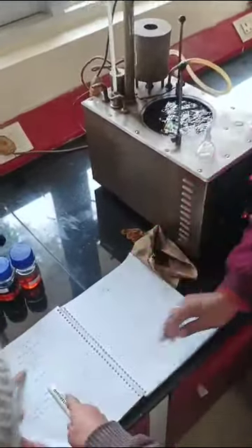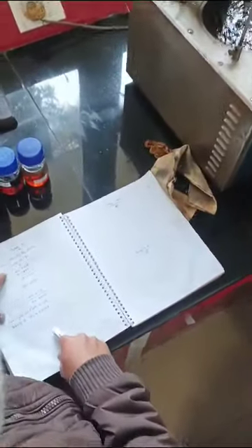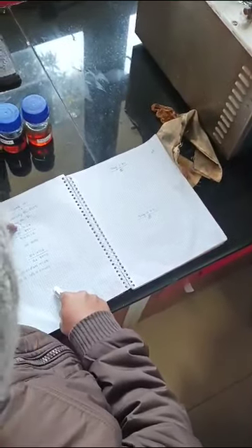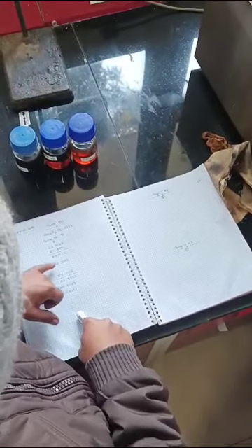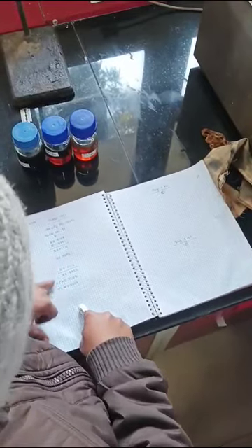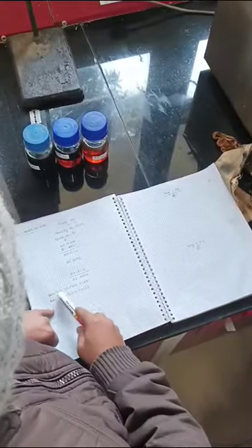See, you have already completed one sample. This is 45.9107. This is the weight of the sample plus bottle. Okay, so after subtracting the empty weight of the bottle, this is the weight of the sample. And I think this is the water equivalent weight. Now, the weight of the sample divided by the water equivalent weight, and this is your density.